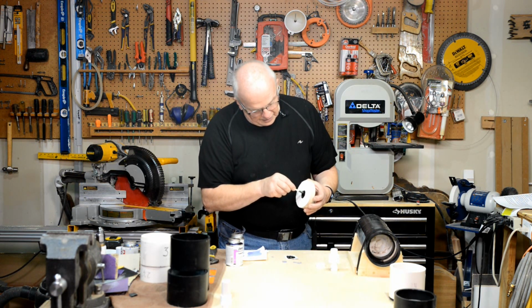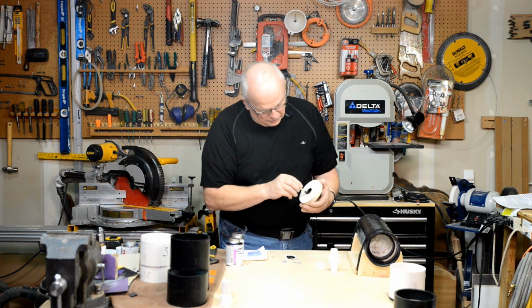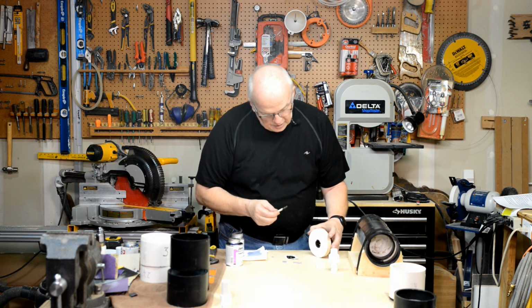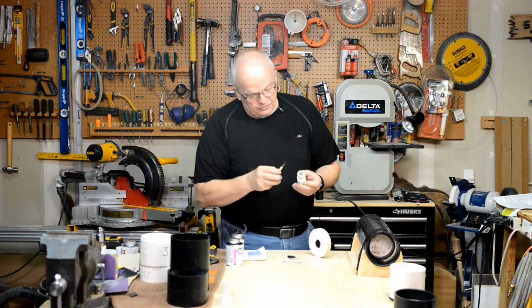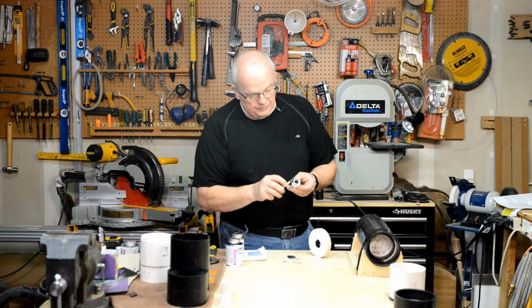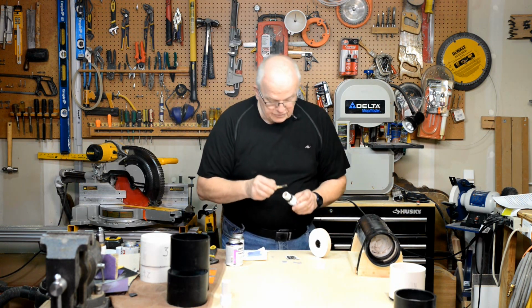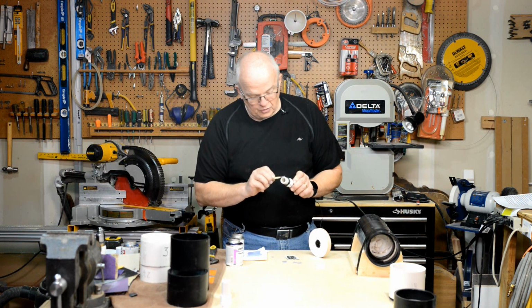A little bit around that on the surface. You want it all the way around though, because if you don't get it all the way around, you're leaving it open for a leak. So make sure that you're rather generous with it. Put a nice ridge on top of that. Okay. Now with that, it's important enough that I'm going to put some around this outside edge. And yes, if I were to do this again, I would have even put a little bit more.